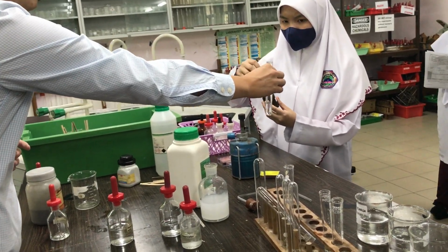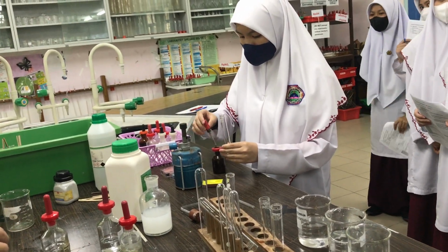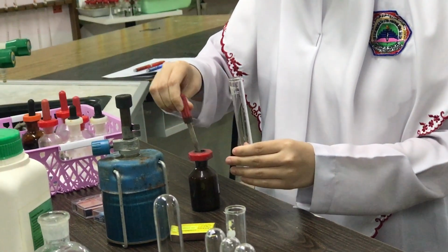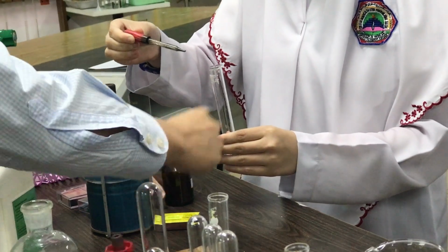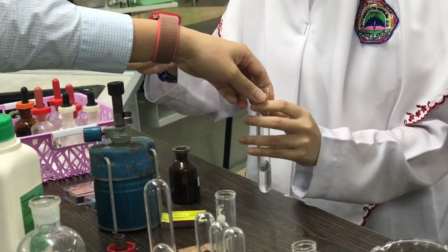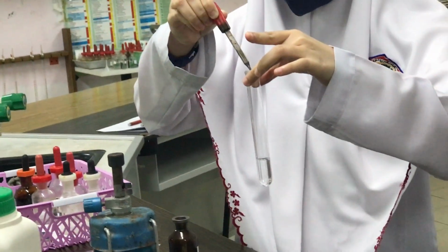Okay, hold the test tube, and then start adding, okay? Just add, and then you will know. Make sure people can see what you are doing. You just hold the top of the test tube. Put a few drops, okay? Hold the top so that people can see what you're doing. Alright. Okay, just add. Hold it high and everyone see what happened.